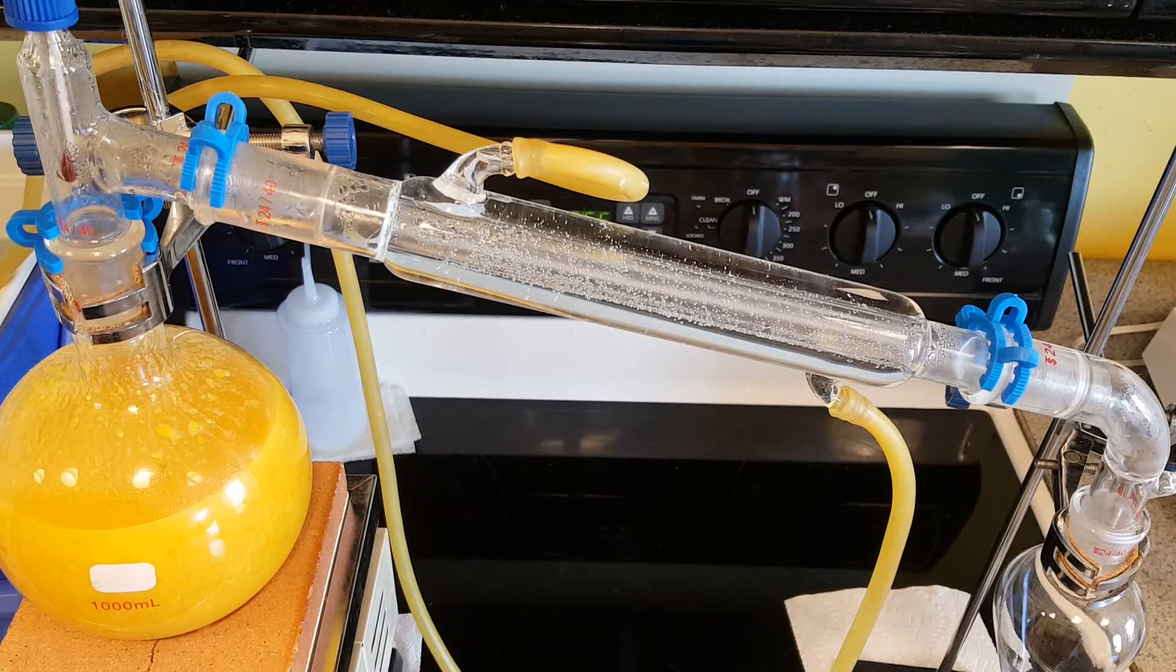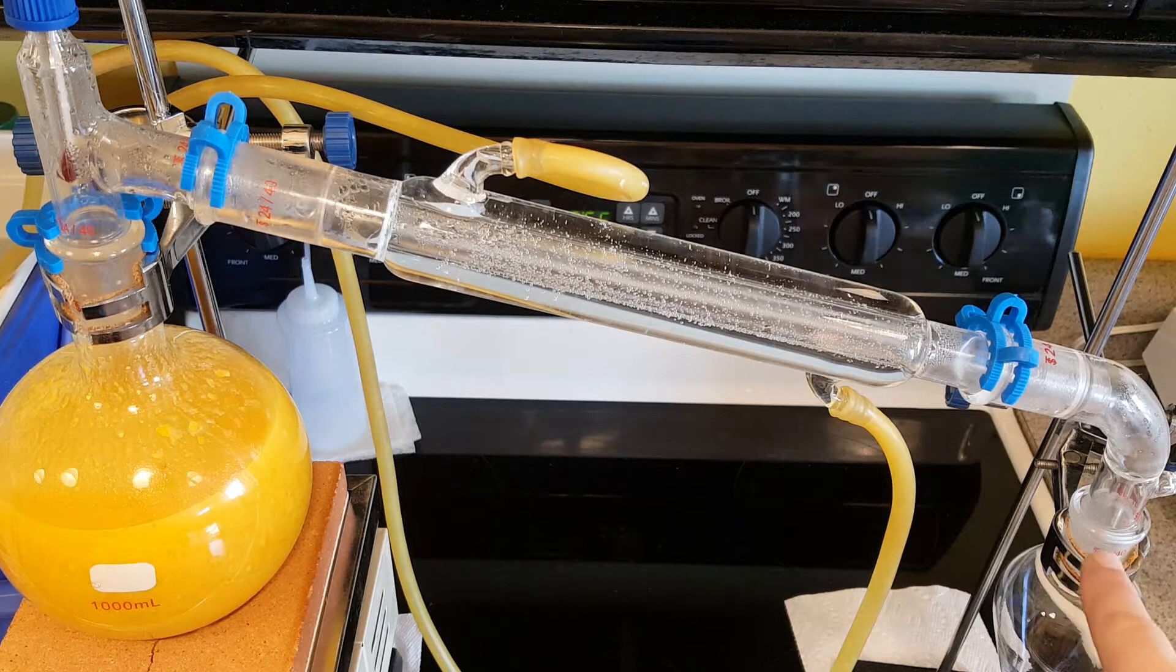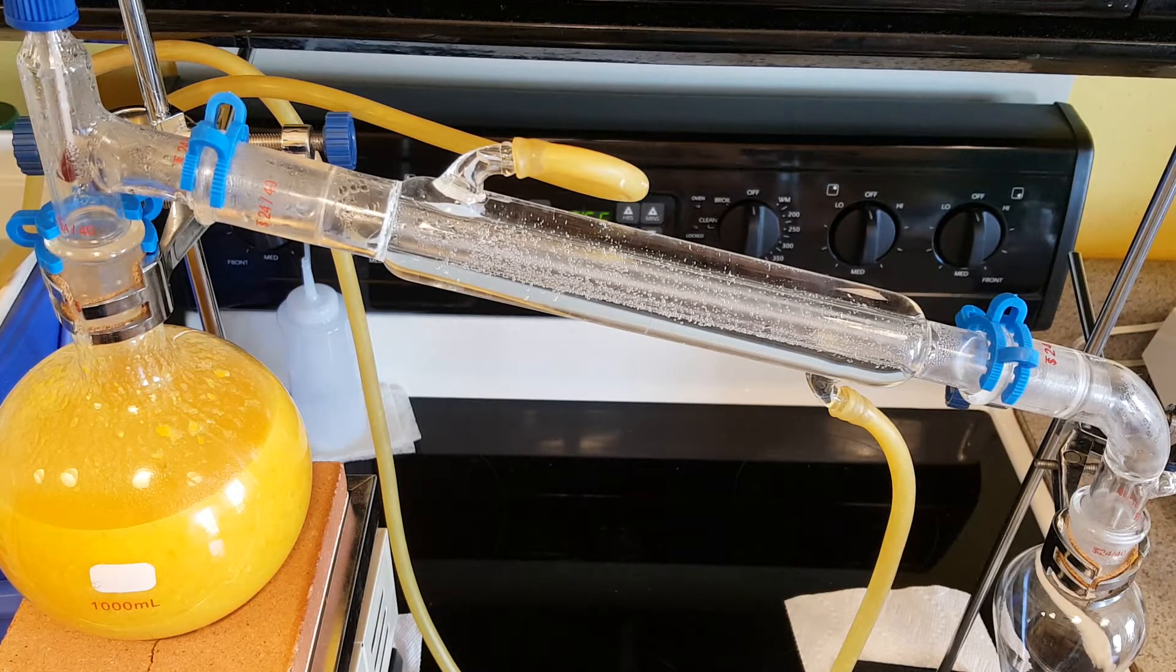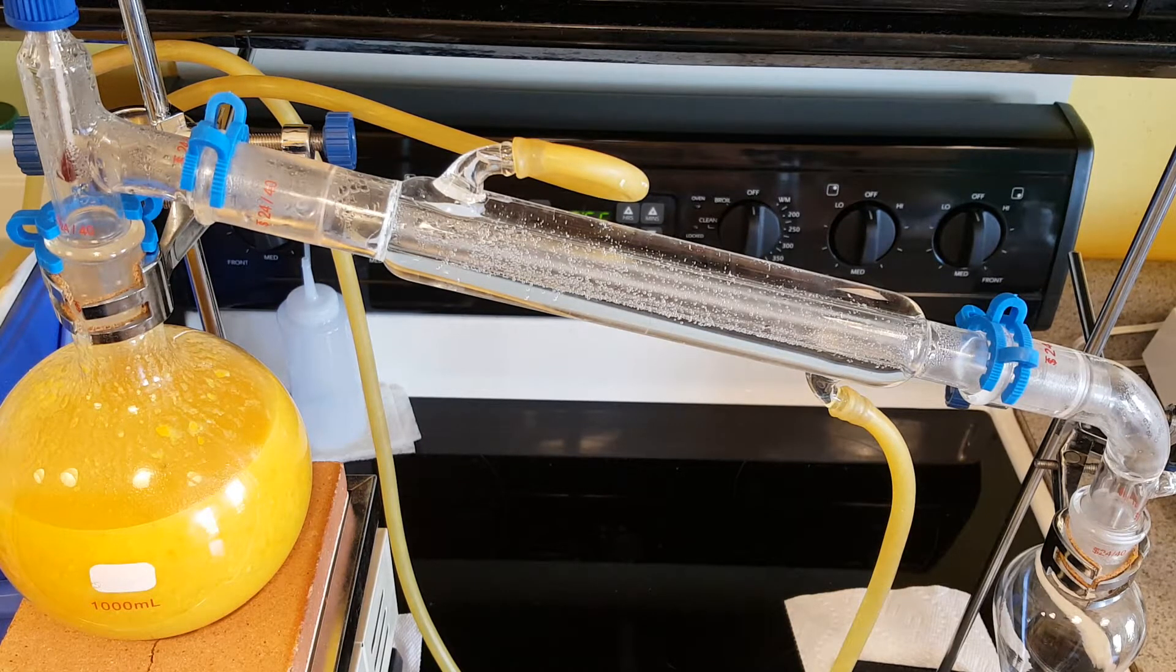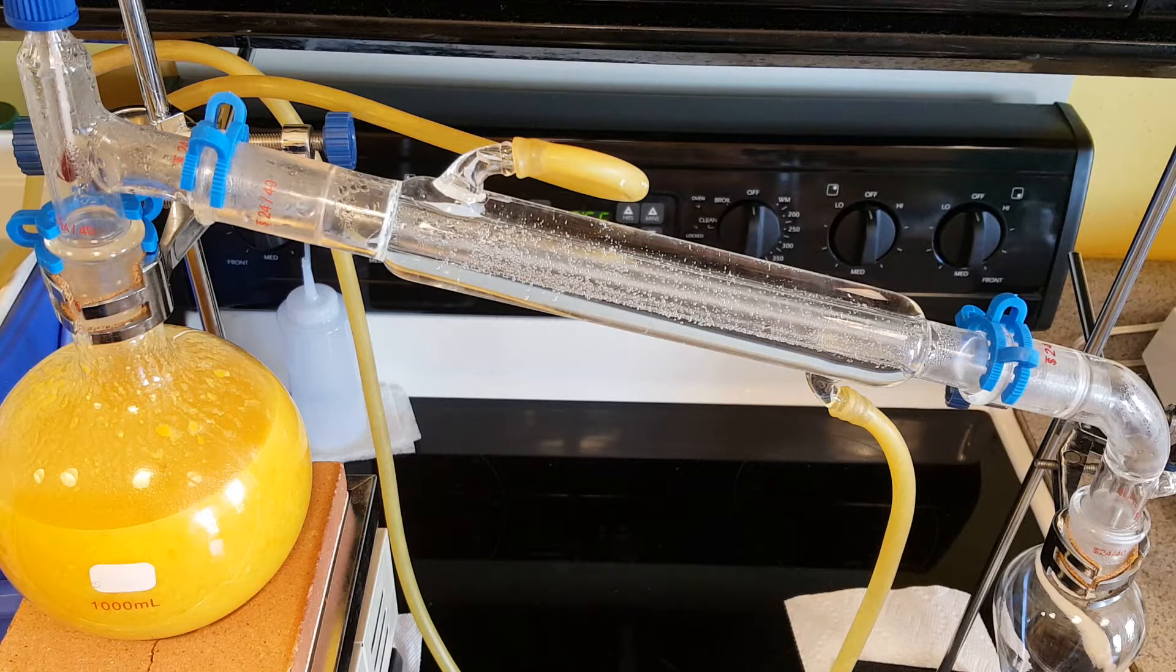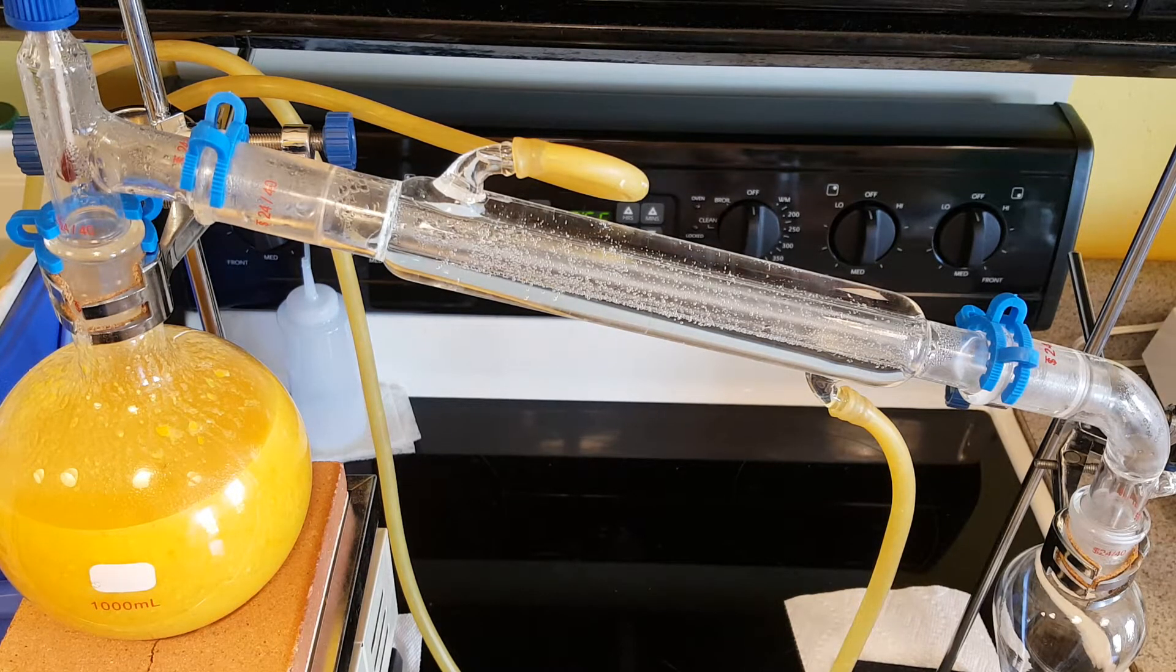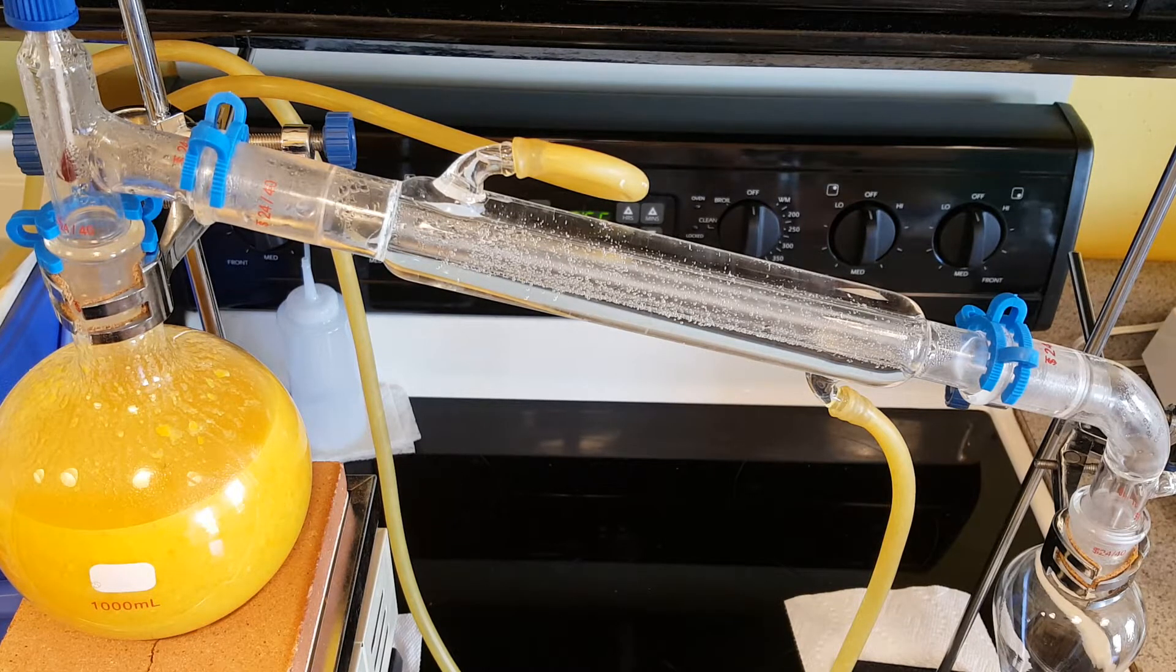I've switched to a separatory funnel for my collection vessel, so that will make it easier to tell how much oil I have versus the liquid. I'm going to fire up this second batch and this time I'll go a little bit slower heating it up.